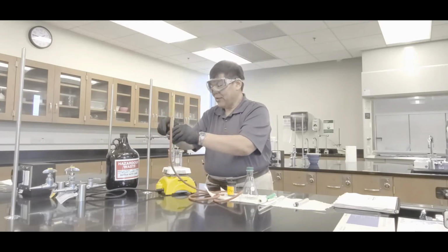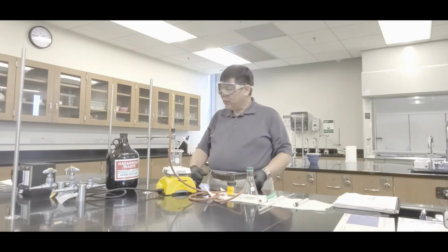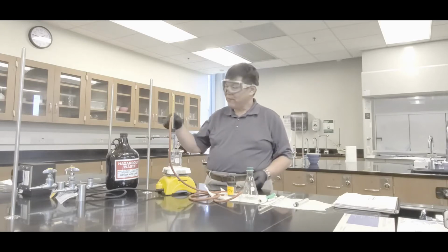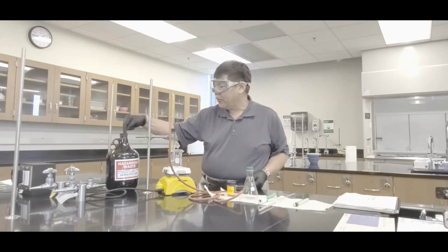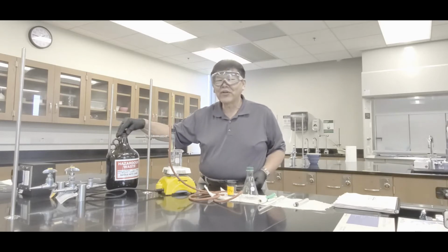Stick it back in here. And then, hey, one other thing. Make sure that you know where the waste container is. This time, do not throw this stuff into the sink, okay? Typically in the lab, they'll provide an organic waste container. All of your waste will go in there by the end of lab, okay? Never down the sink. Making sense? All right, very good then.